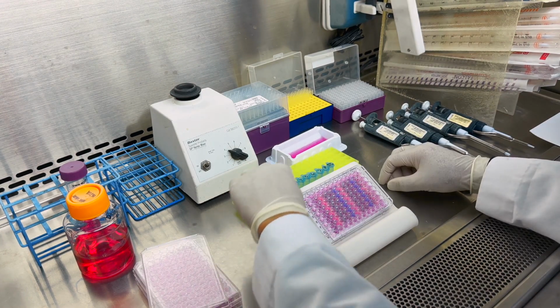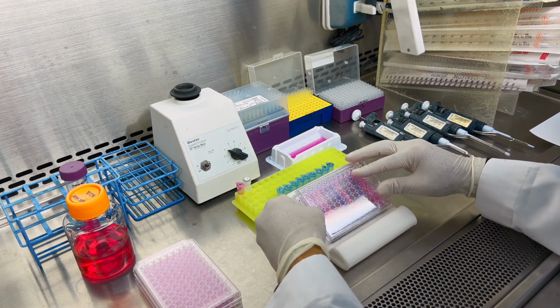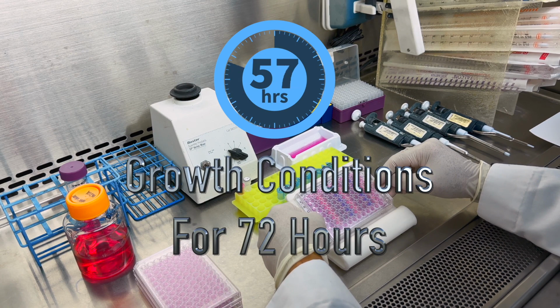Once you've completed adding all your sample dilutions to the plate, replace the lid. And you'll want to transfer your plate into the appropriate growth conditions for 72 hours.